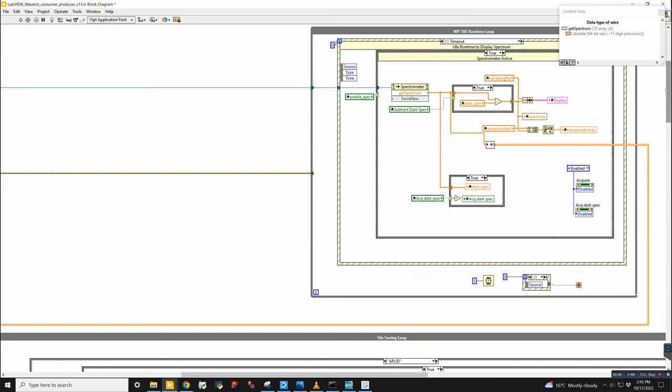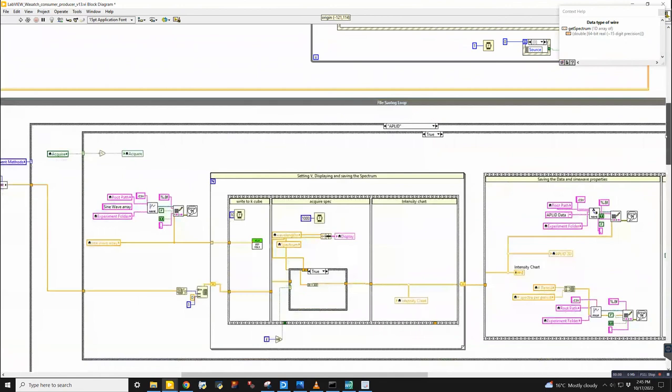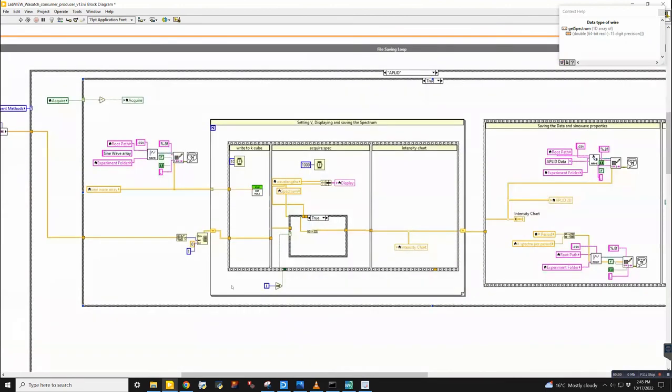So this is why usually you want to do the consumer producer handshaking, because it ensures that you're synchronized between your acquisition and saving functionalities. But this will work. This will produce the data, but that's somewhere that the functionality can be improved. The algorithm makes sense though. So every time this executes with a different K cube voltage that's set, we write that to the display.